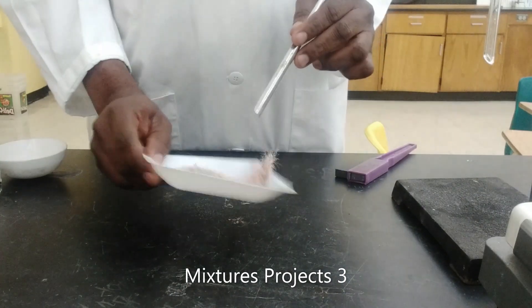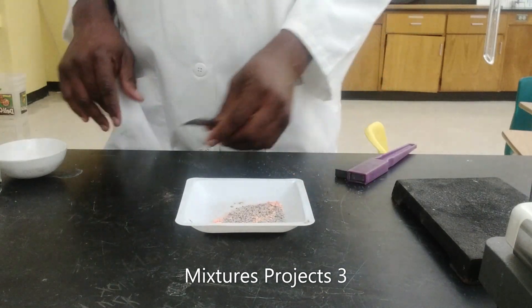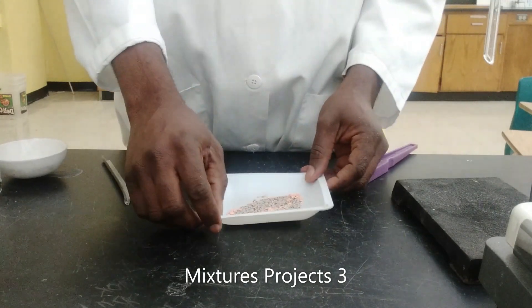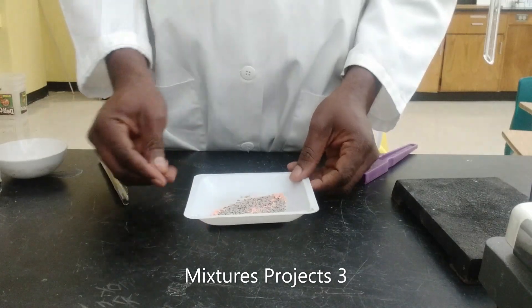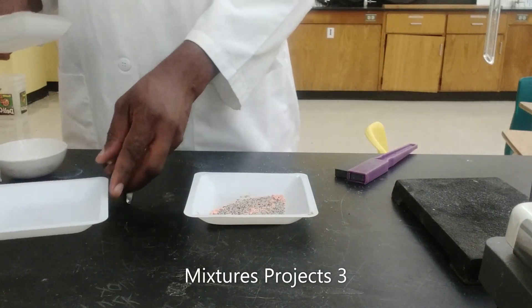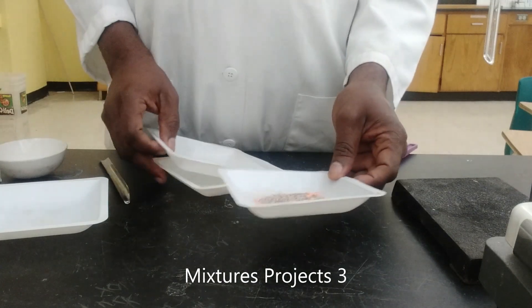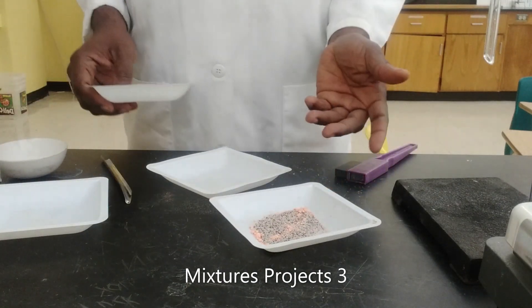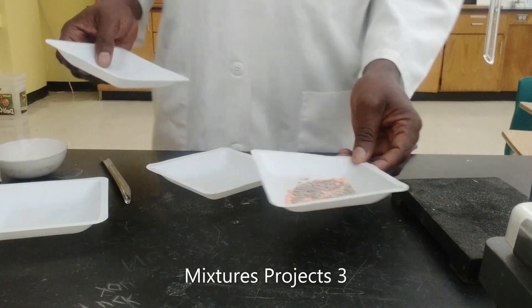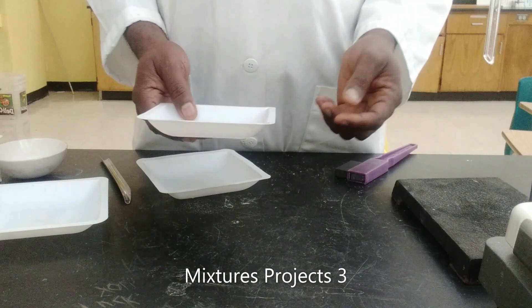In order to separate them into their individual components, I will be making use of some of their physical properties. Remember, mixtures are basically a physical combination of two or more substances, in which case the substances that you've combined did not chemically react. So in that way, I can employ the use of their physical properties to separate them.